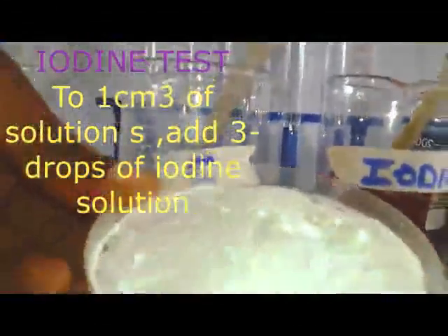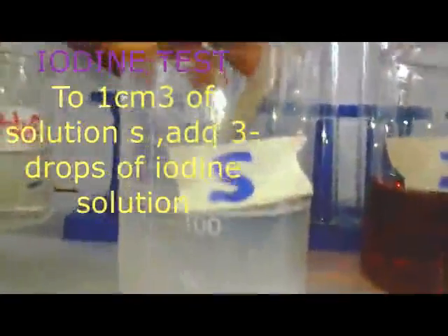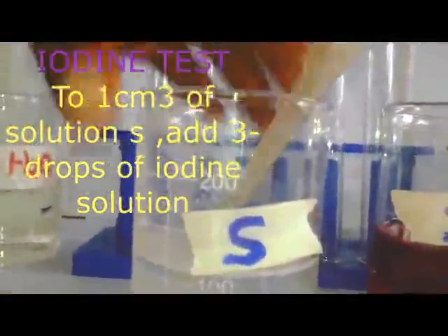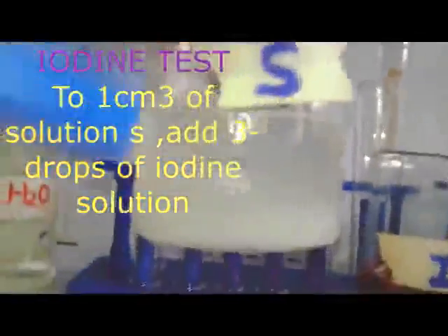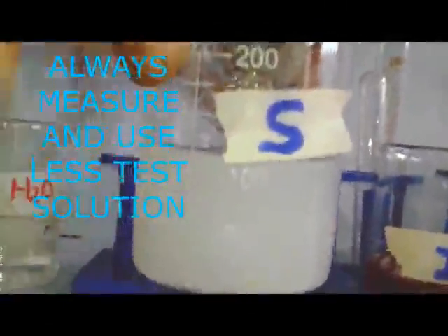First of all, we are going to look at the color of this one before we test. When you are carrying out a food test and you are recording, you record the initial color, that is the beginning color, and then the final color. This solution, we can say, is turbid. You can see that turbidity. So we say turbid solution. When you are recording, you write turbid solution. Then this one, of course, is brown as we are seeing.